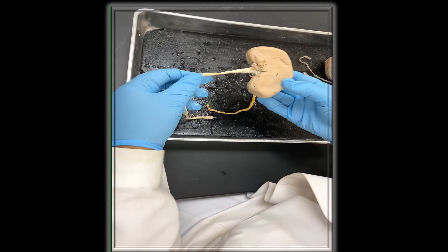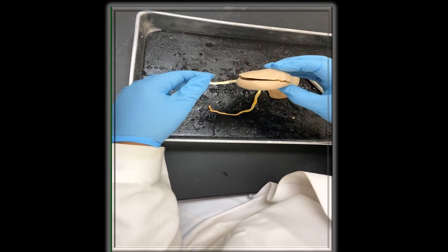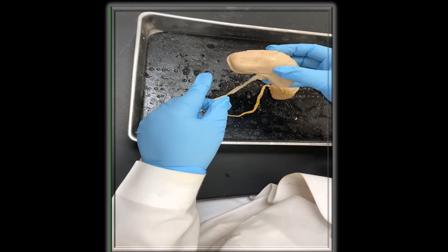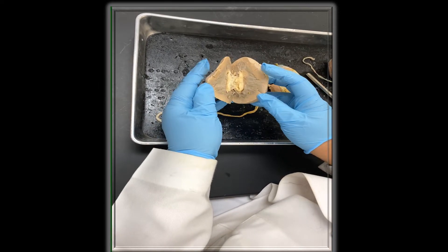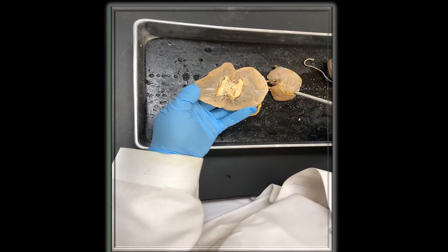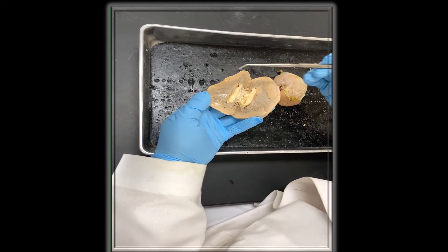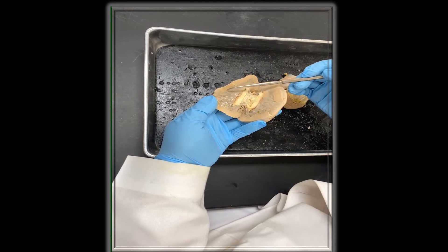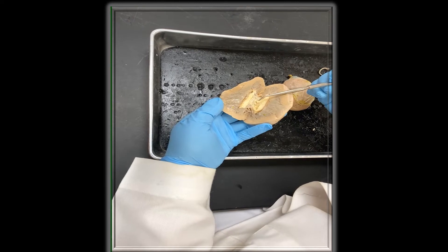Here is a whole specimen. You can distinctly see the bean shaped structure, what is called the kidney bean. Now if we take a cross section, we can see inside. We can mostly see two distinct areas: here is the cortex, here is the medulla — the renal cortex and renal medulla, to be more specific.